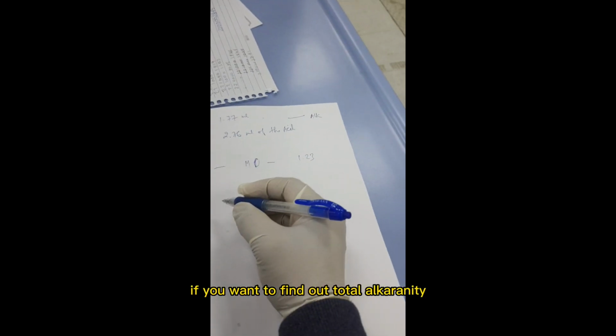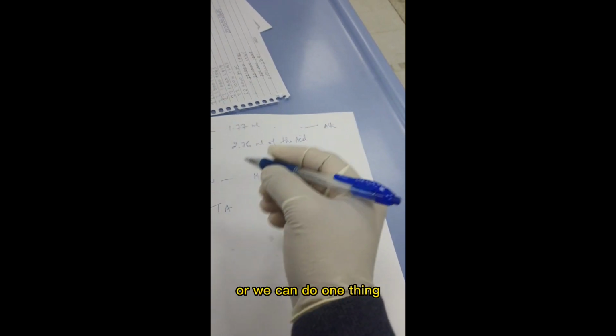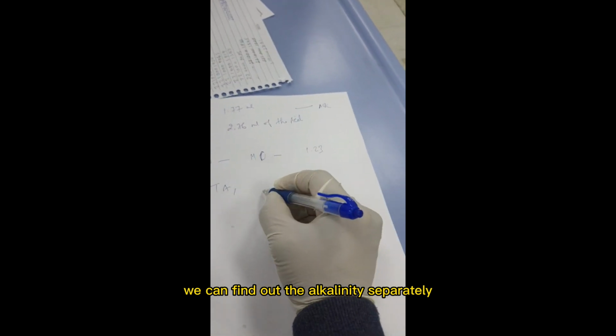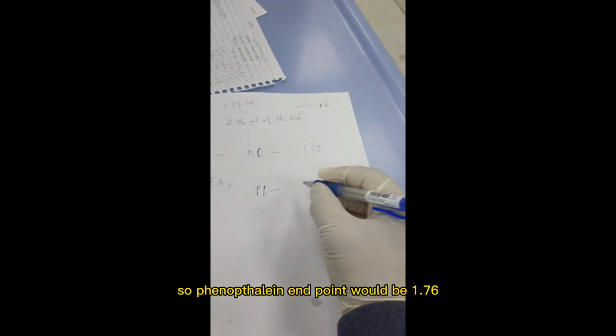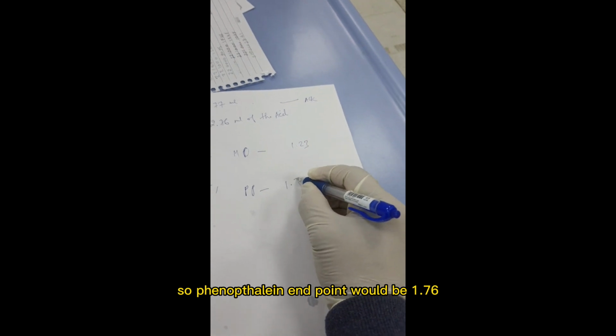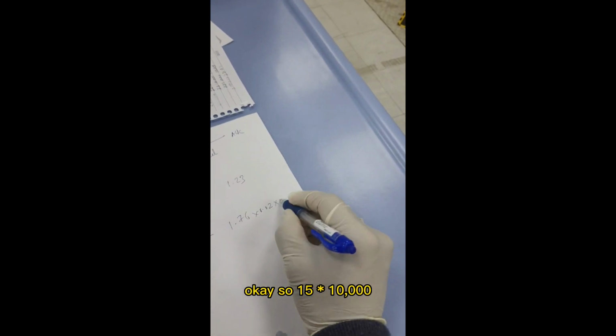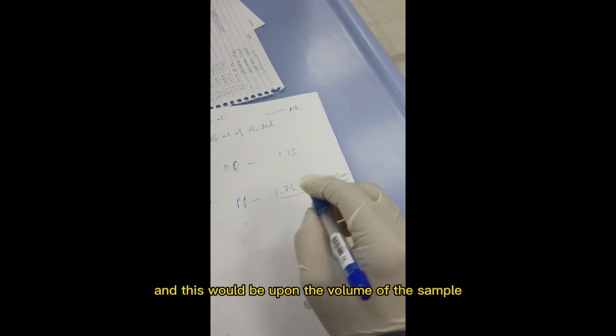if you want to find out total alkalinity, we can find out the alkalinity separately. So the phenolphthalein point will be 1.76, the normality here is 0.02, and the acid is already standardized. So 50 into 1000, and this would be upon the volume of the sample.